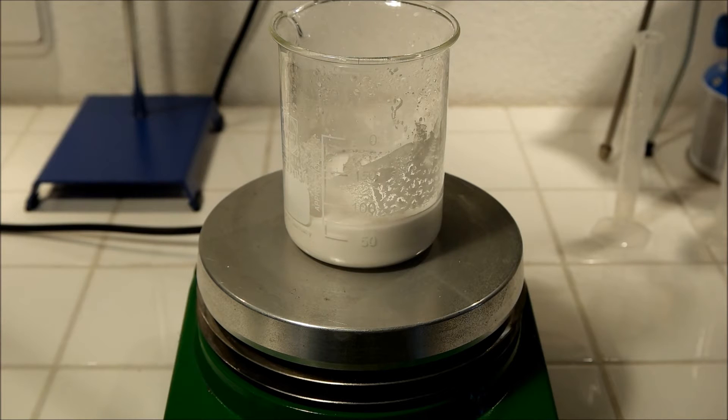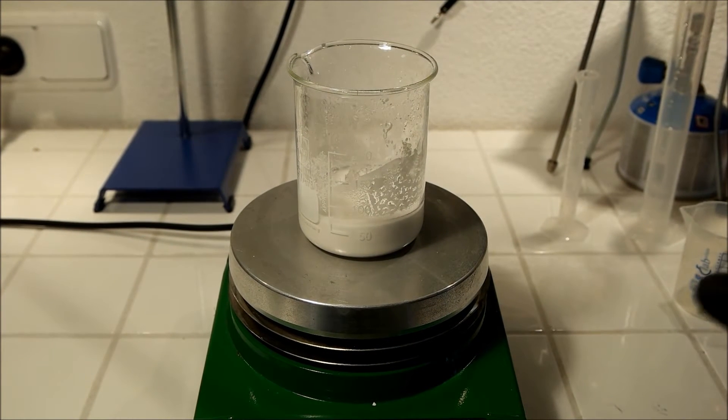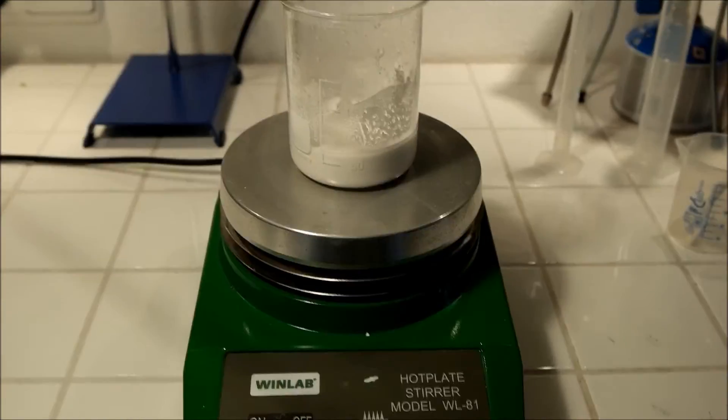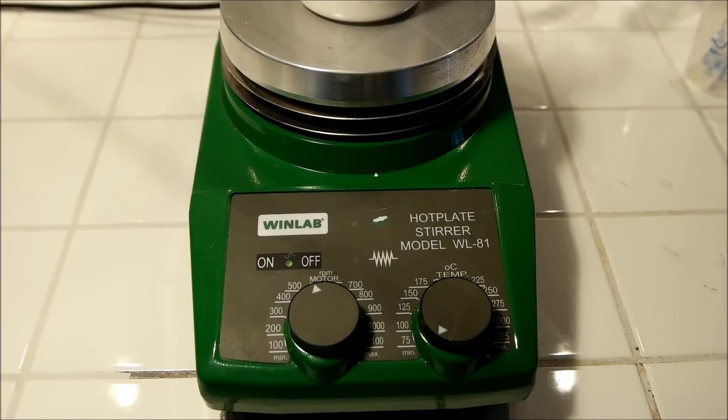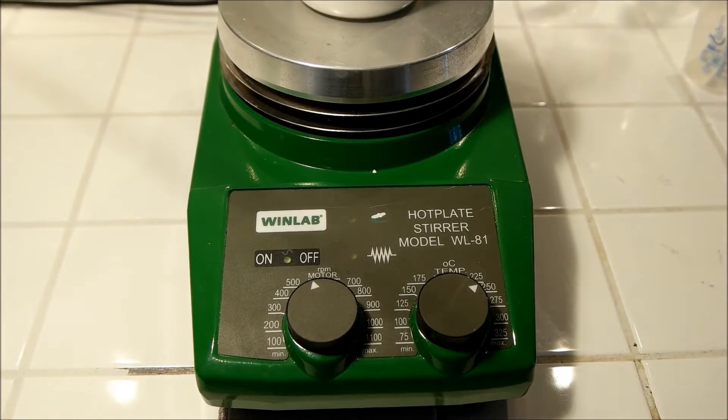The bubbles that you just saw were CO2 gas, by the way. The last step is just to evaporate all the water. So what I'm gonna do is just turn on the hot plate to let the water evaporate.